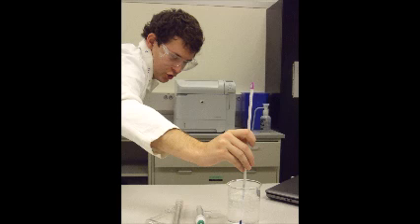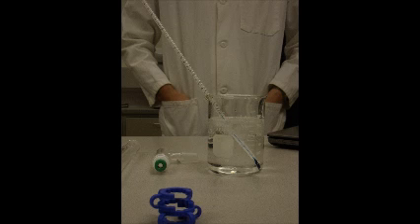To do this, insert a thermometer into ice water and wait for the temperature to settle. If the thermometer reads more than plus or minus 2 degrees than what it should be, in this case zero because we are measuring ice, then it needs to be replaced and the calibration test needs to be repeated until a new thermometer works properly.